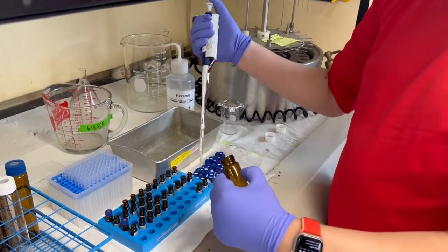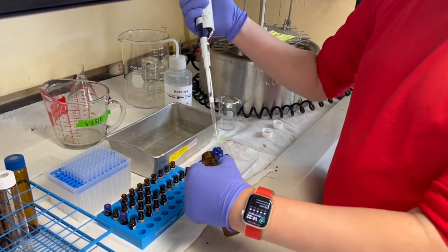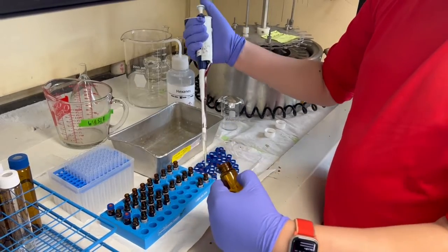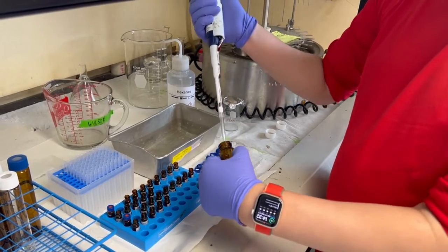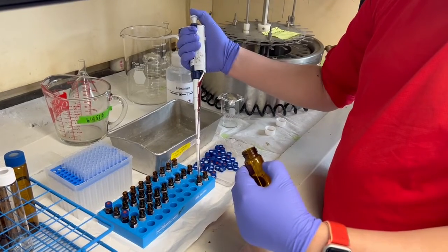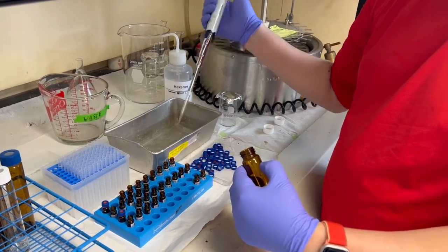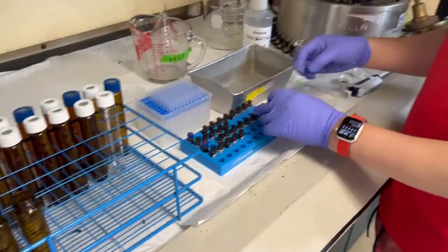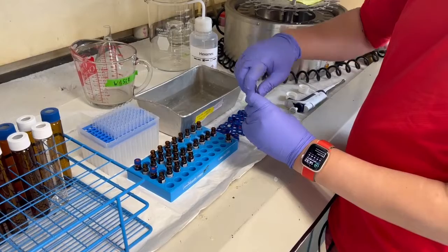Yeah, that's interesting because they add two milliliters. That's interesting. I guess it's fine.